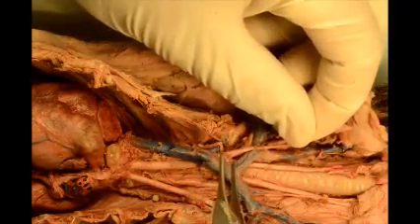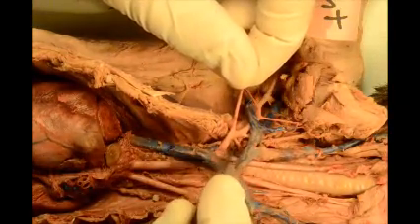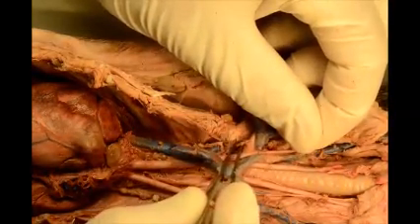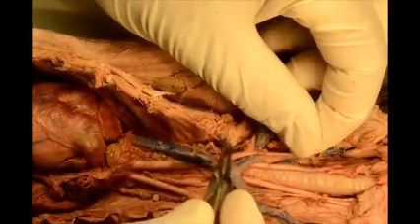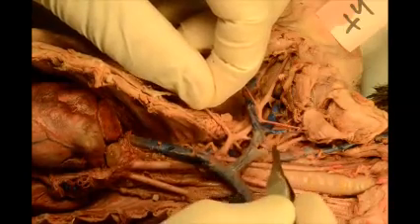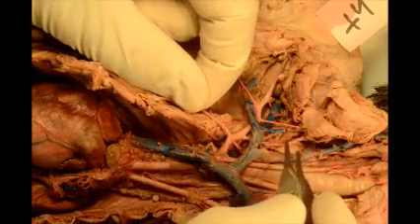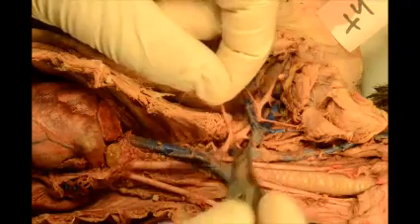Let's review. Here's the V — vertebral — which goes towards the vertebra. C — costocervical — here's this one, and it's by the rib; it goes right into this rib right here. And T — thyrocervical — which goes towards the thyroid region, and cervical means the neck. So those are the branches of the subclavian.